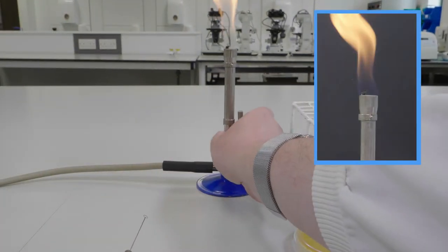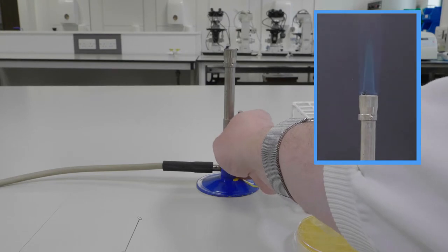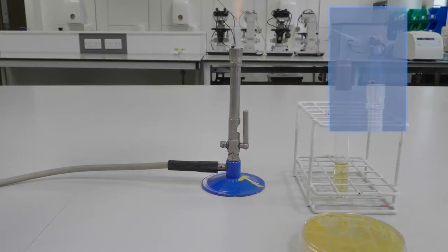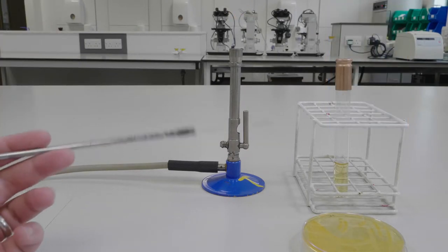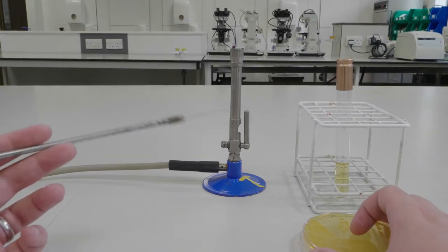So let's get started. Activate the blue flame on your Bunsen burner by turning the collar at the bottom of the burner and sterilize your loop by passing it through the hottest part of the Bunsen flame. Allow your loop to cool before proceeding.